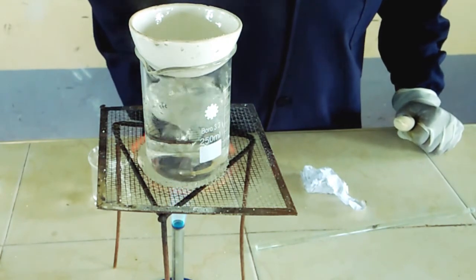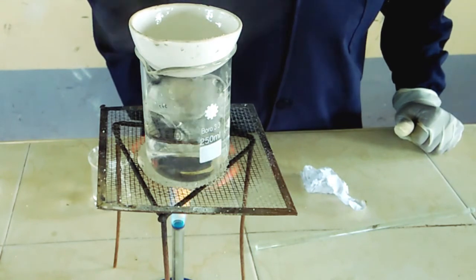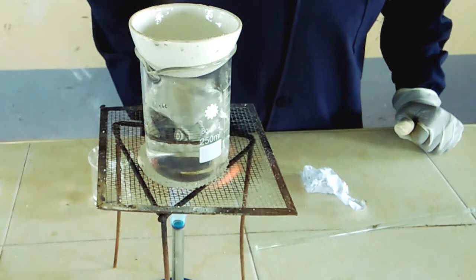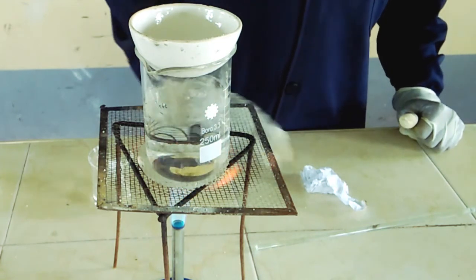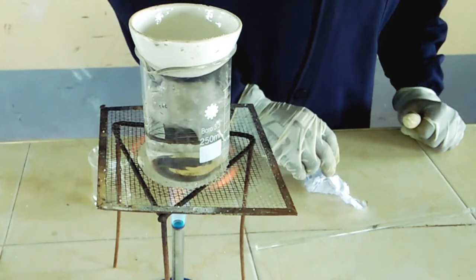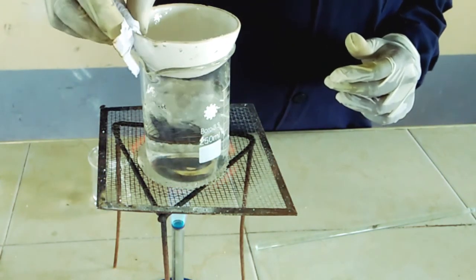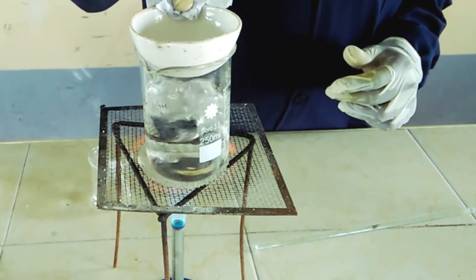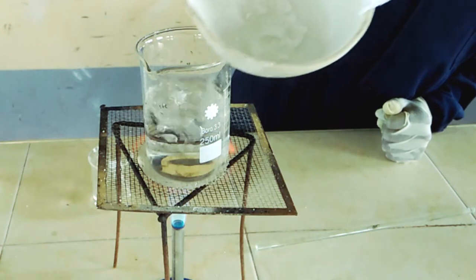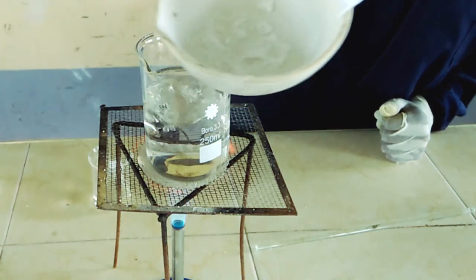Good. Wonderful. So already our salt is forming. The water is evaporating, so we are remaining with the salt. Good. So already we have driven out the water, and I think we have recovered our salt. So eventually this is what we have, our salt, after driving out the excess water, and we have been able to separate and recover each of the substances in the mixture. Thank you.